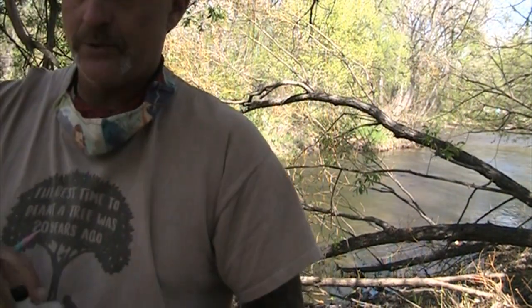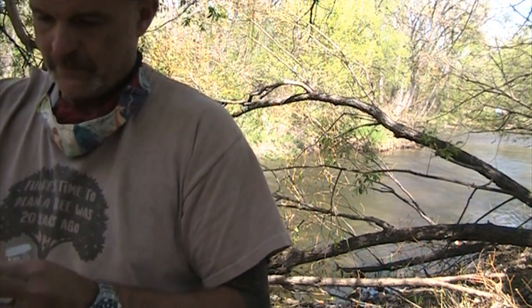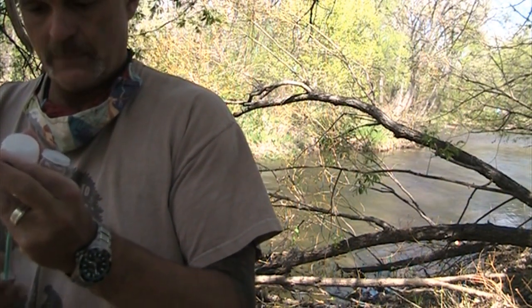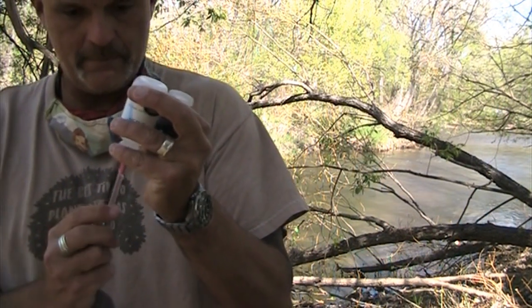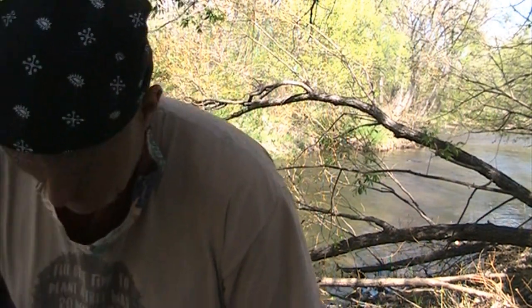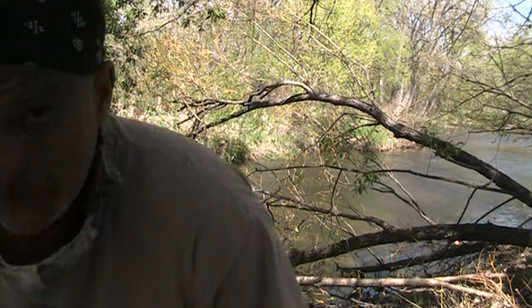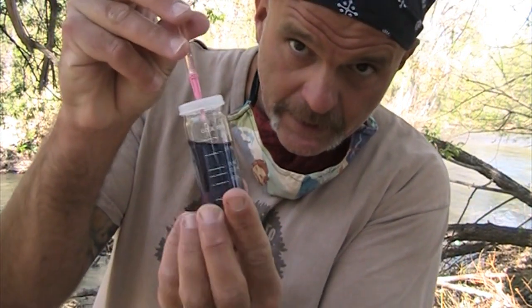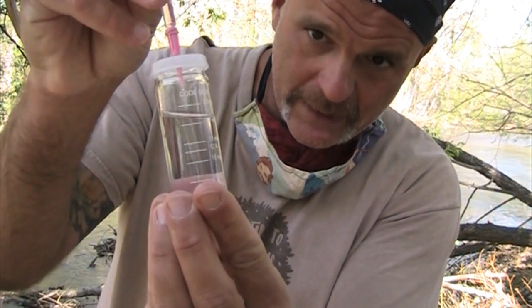Now I'm going to refill the syringe and just add more sodium thiosulfate. Again, doing the creepy nurse flick of science. So let's try to get this titration again. Add a drop, swirl. Ooh, that was that close.